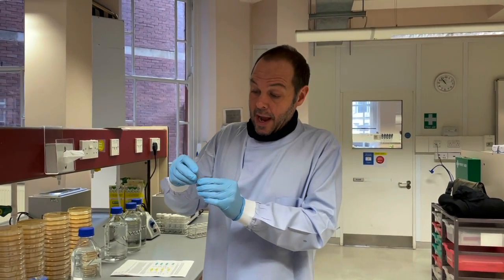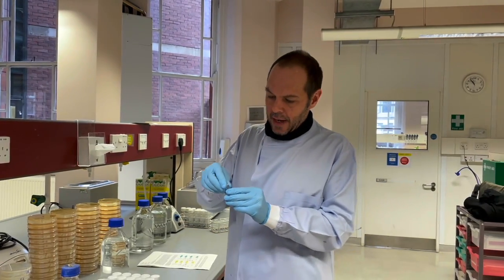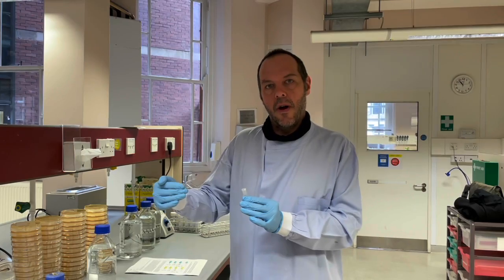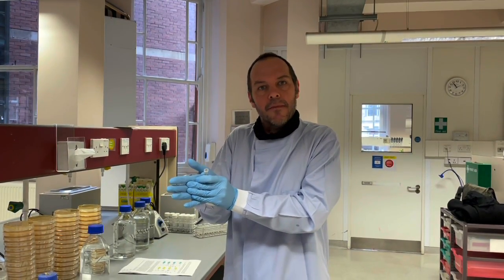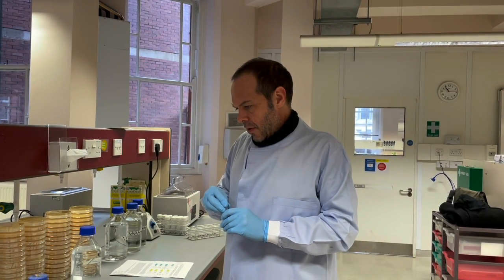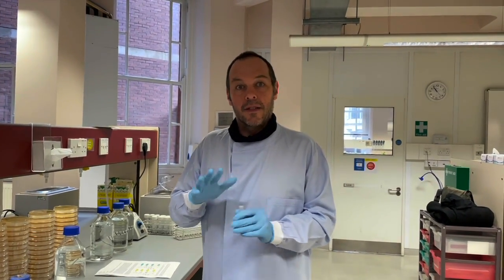So we'd expect these are all samples from the same population, and then we're going to dilute these down so that we can count how many cells there are, and we can also count how many of each type. Really what I want you to think about is what causes the variation. We know they all came from the same population. Right, let's start with the first dilution. I wonder if we should just stop the video here, because this seemed okay.